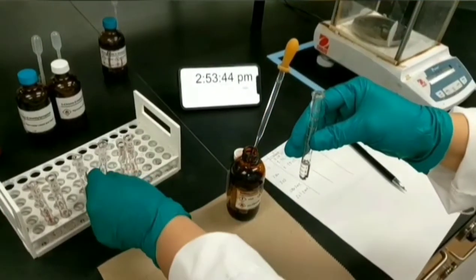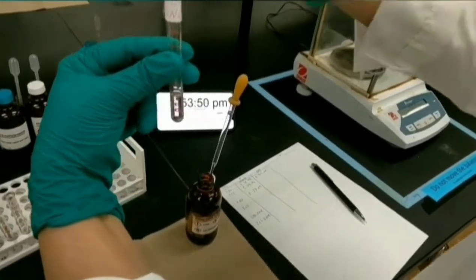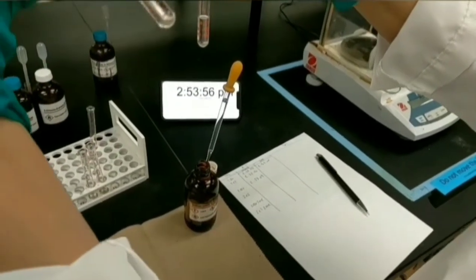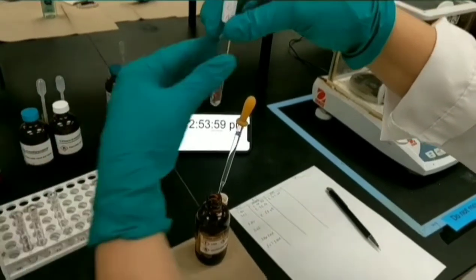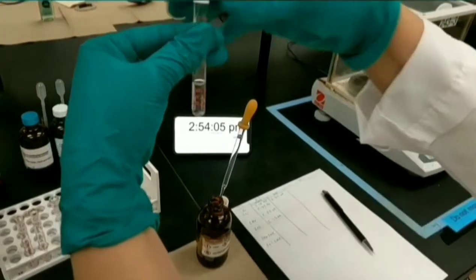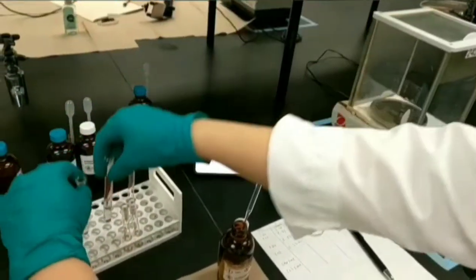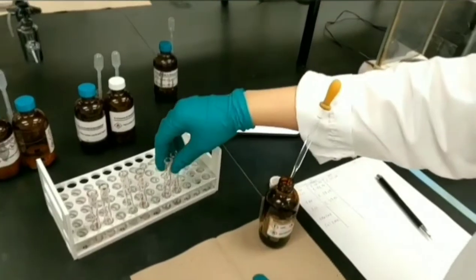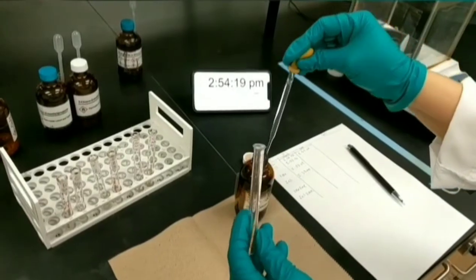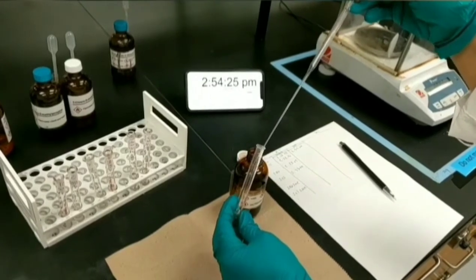I'm going to add the nucleophile to the next test tube of 2-chlorobutane. You need to record the time now. I'm checking the other test tubes for any precipitation. As you can see, we have not any immediate reaction for these test tubes. So I'm going to continue adding nucleophile to the next test tube of 2-bromo-2-methylpropane, which is a tertiary alkyl halide.